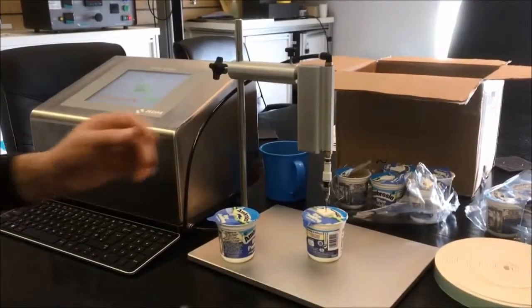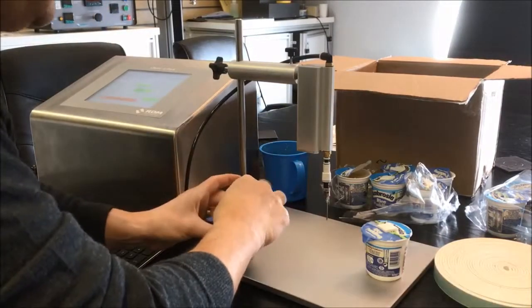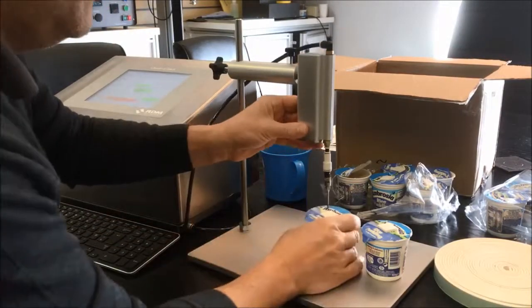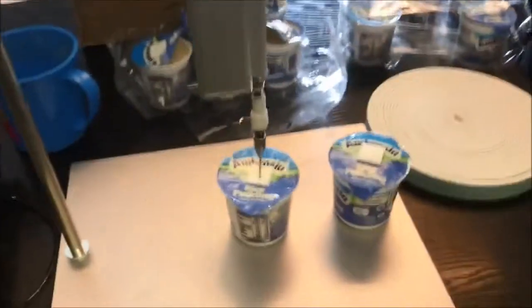Okay, let's just switch it over. The test has ended, so just pop that one out and put a septum on this pack, pop the needle in.